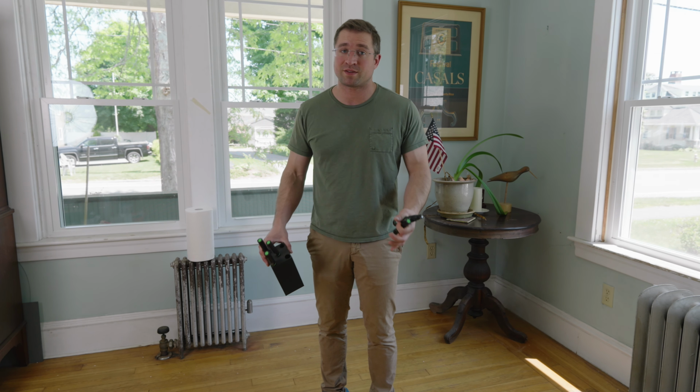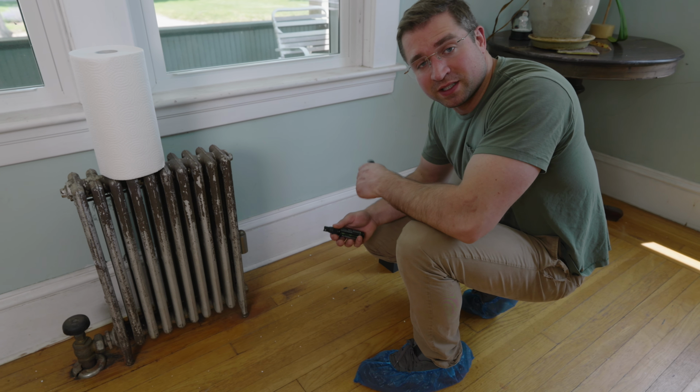I'm standing on lead-based paint dust right now. That's why I have these shoe covers on. Let's see if we can observe it with FluoroSpec instead of getting a dust wipe and waiting a few days for the results. Lead-based paint dust contamination happens for one of two reasons.